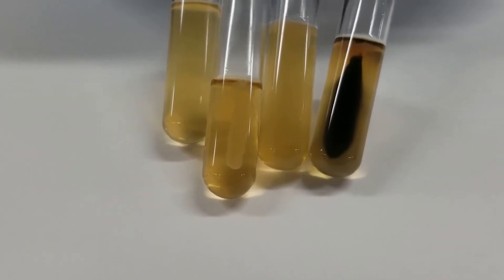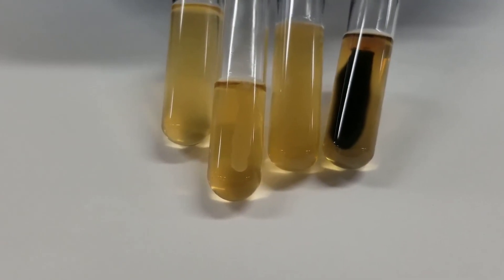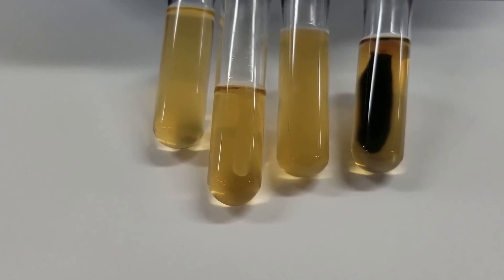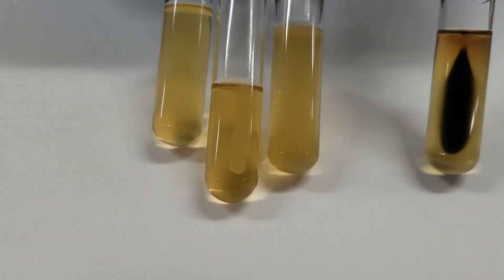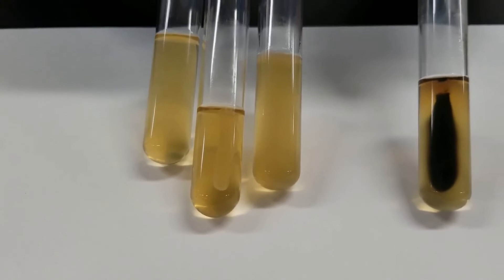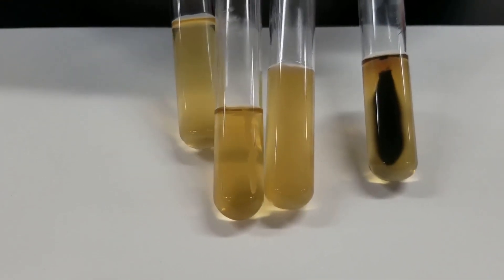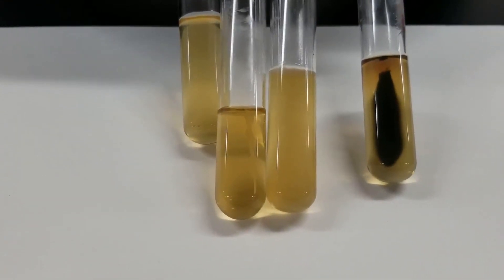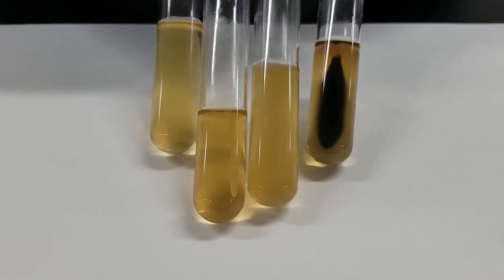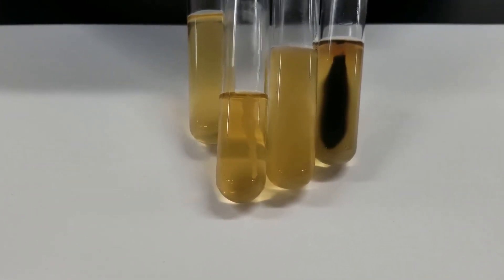So that is the SIM — S-I-M — the S stands for sulfide, the hydrogen sulfide production. Proteus vulgaris would definitely be a positive for that, whereas Enterobacter aerogenes and Staphylococcus aureus are obviously negative because there is no black coloration. We will look at the indole production later.